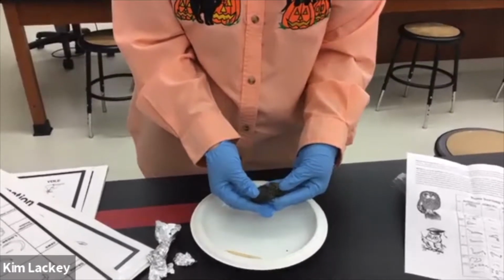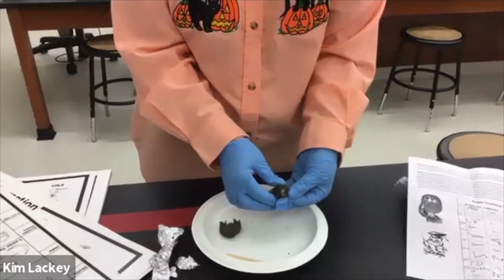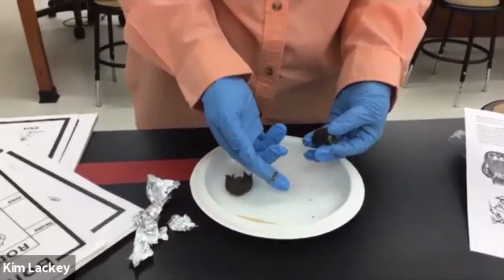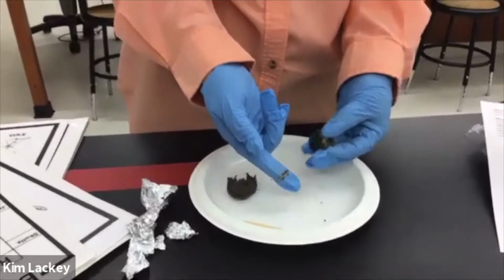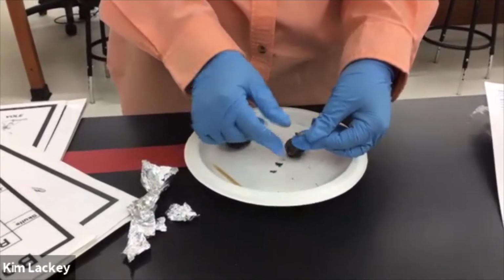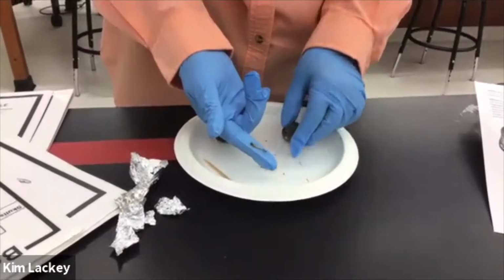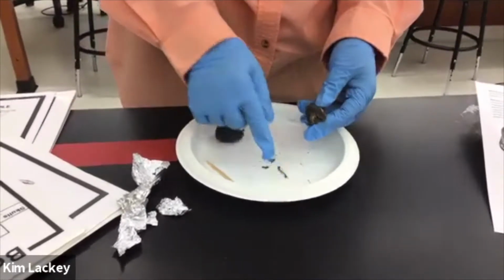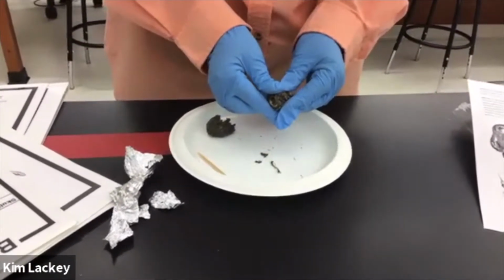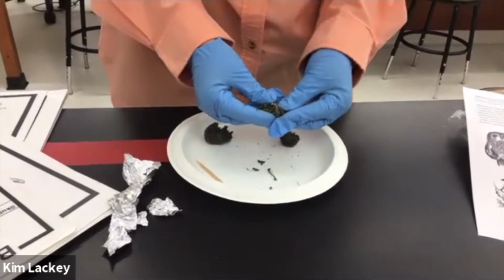It's always better if you gently tease it apart and you start looking in here and you'll start identifying and pulling out these different bones. Okay, so here's one bone. Now, granted, there's a lot of fur packed around it, but the first thing you need to do is just tease out these different bones and put them in a pile. We may not know exactly what bone we're looking at, but then later we'll go to the bone chart and try to figure it out.